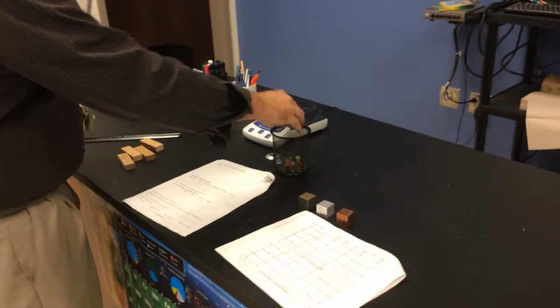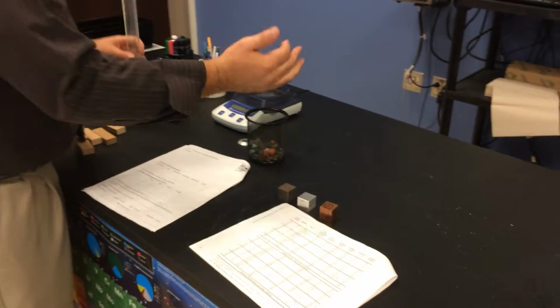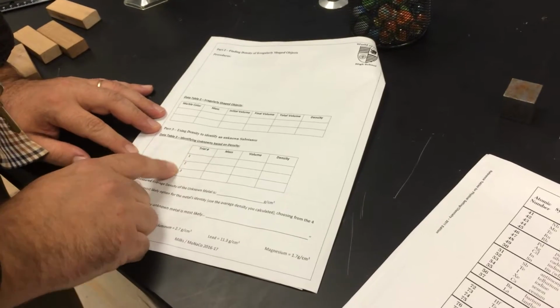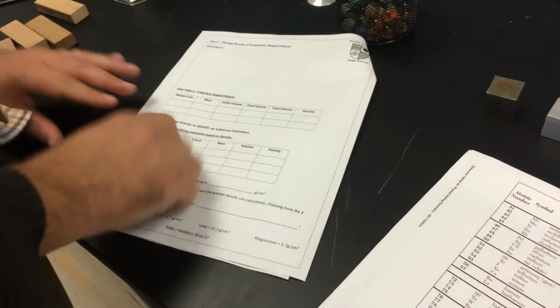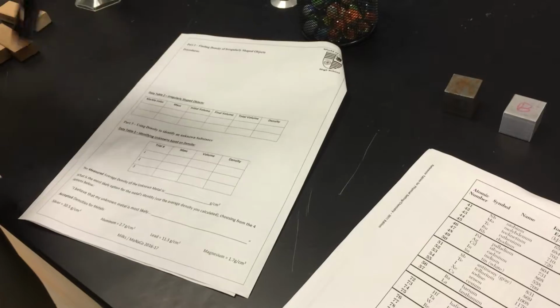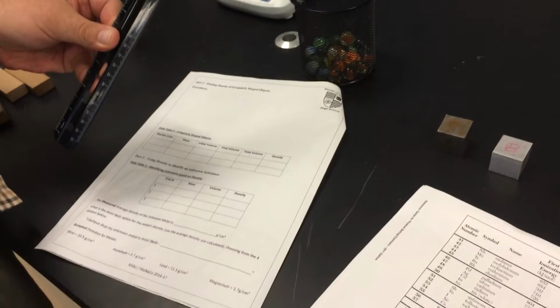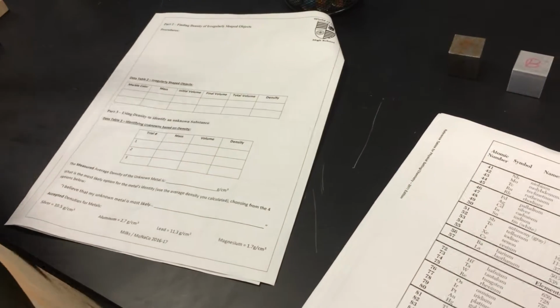Then to the big bad Holyfield. This is the real deal. There are 3 unknowns. You're going to pick one. In the unknown, you're going to do trial 1, 2, and 3: you, your partner, and your other partner. You're going to use 1. Mass it. Volume old school. Calculate what its average density is. Then we're going to use the big bad reference table. Density of all of our elements is here.